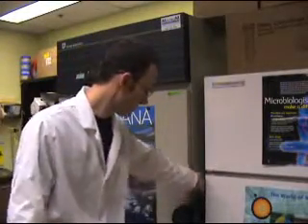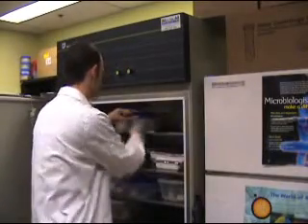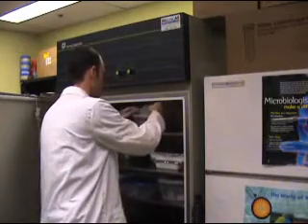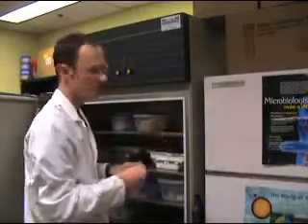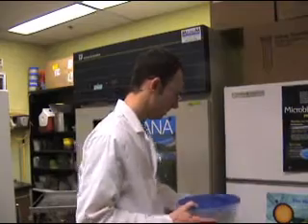It's been six days, so let's go ahead and check how our soil plates are doing. These are looking good. Some of these colonies look really good, so let's take them over to our fungal expert and have him look at them to see if he thinks any have potential as an insect pathogen.